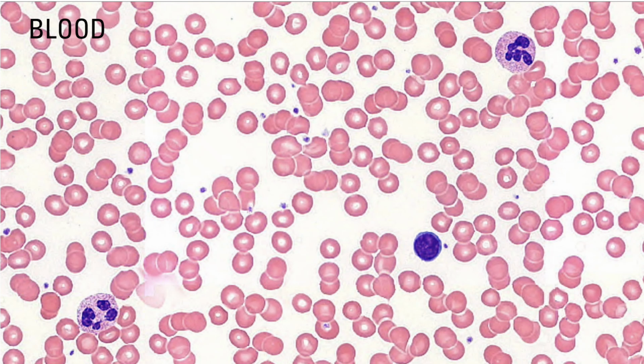Blood is the only fluid connective tissue that we'll see here. The matrix is composed of water and electrolytes and contains proteins that can form fibers during clotting. Since the protein fibers are present, even only transiently, this qualifies as a connective tissue. There are three classes of formed elements found in the blood. The most numerous are red blood cells or erythrocytes, composing the vast majority of our field here.